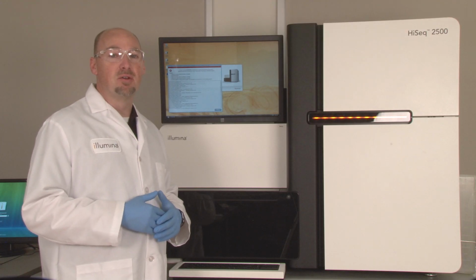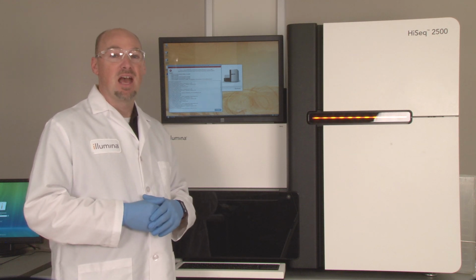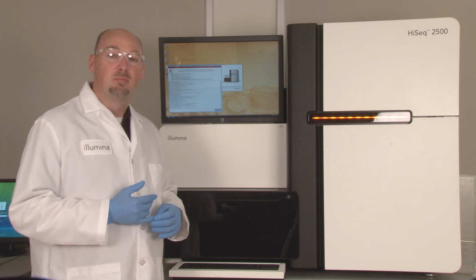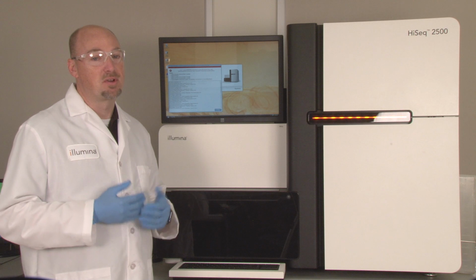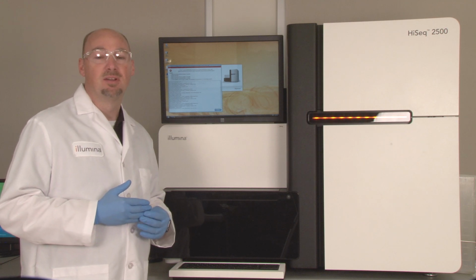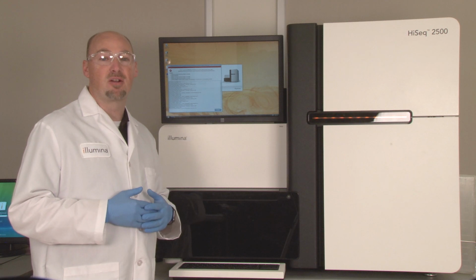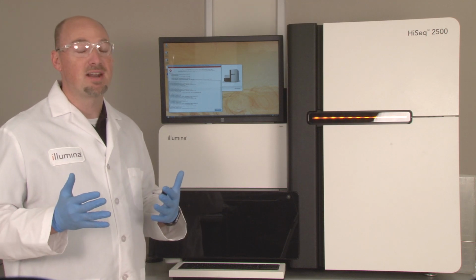When communication ports are closed improperly by the software, new communication can be claimed by the incorrect port number. After a communication port is claimed, it reconnects in the same order with a simple restart of the computer. An incorrectly connected communication port prevents the HiSeq control software from communicating with the subsystem normally allotted to that port, which would cause an initialization failure. To correct this, we can use a program called Port Manager, which can release all existing communication port connections. When your instrument PC is restarted, all communication ports will reestablish in the default configuration, usually resolving any existing communication disruptions. Here's how to use Port Manager.